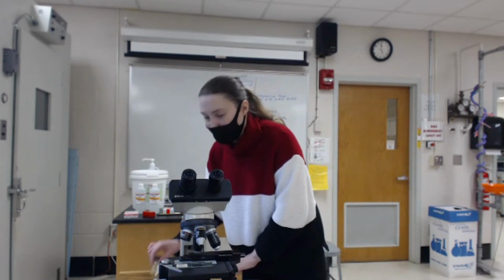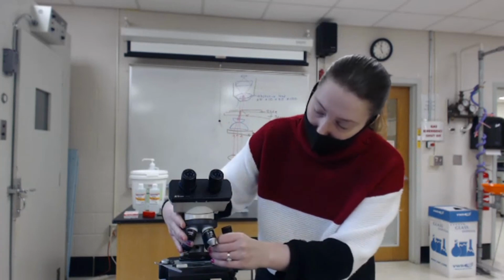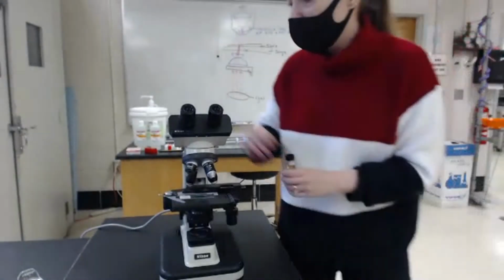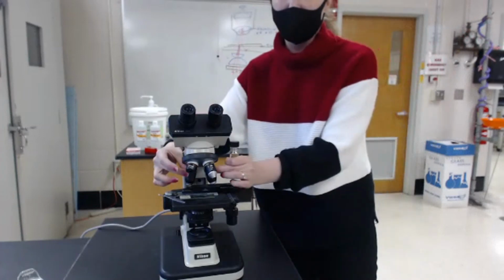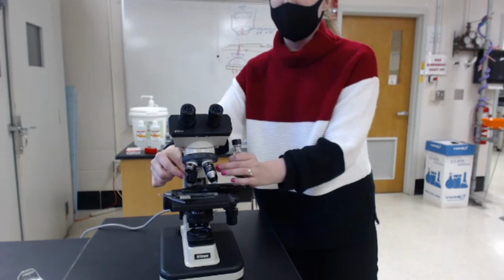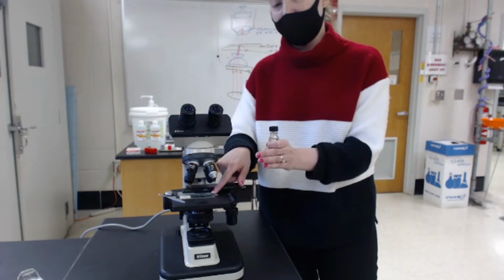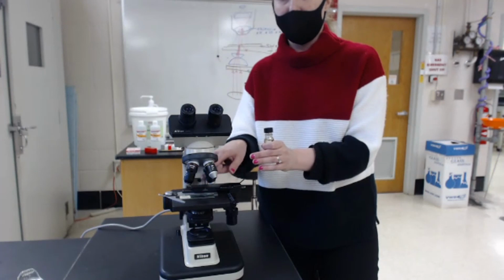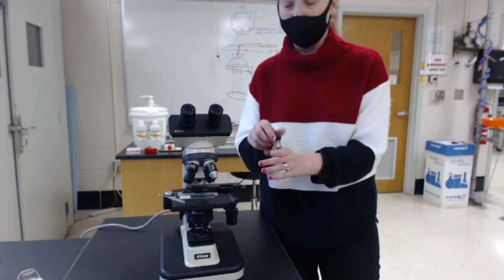So how are we going to approach this oil immersion? When we're working with the oil immersion lens, I like to bring the stage downwards. So I'm going to direct it towards the microscope. We're going to move the stage down, and we'll take the high power and the oil immersion lens and straddle the sample or the slide so that we have a lot of working space here. So we can add a drop of oil without getting it onto the lenses quite yet.